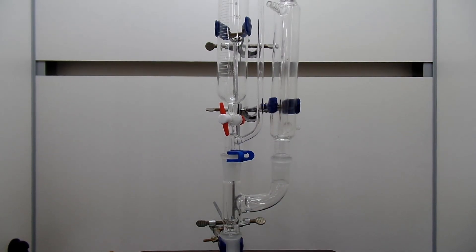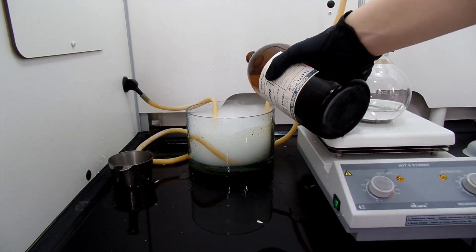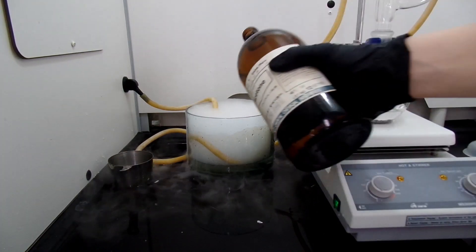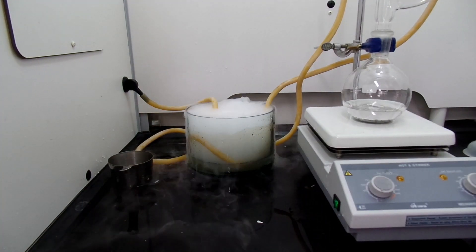We should deal with boiling diethyl ether in this experiment. So I came up with this setup. On the top of the flask, I connected a Claisen adapter where addition funnel and condenser is added. You will see how much vigorous diethyl ether boils off later in the video. And you should have a cold water recirculator for your condenser or you will lose all your ether because Grignard reaction is quite exothermic.